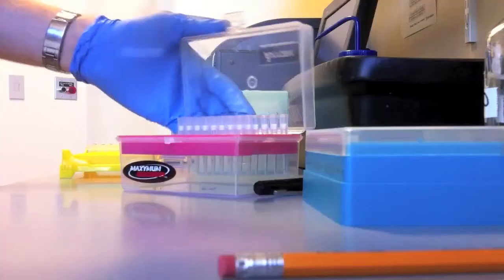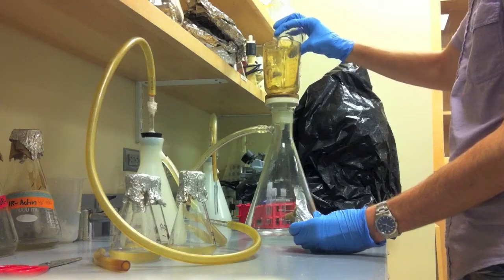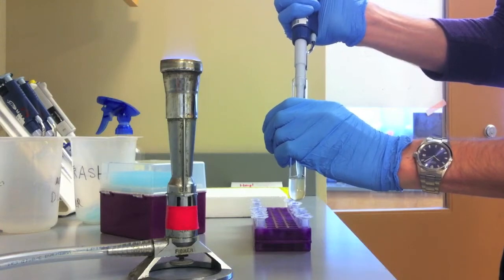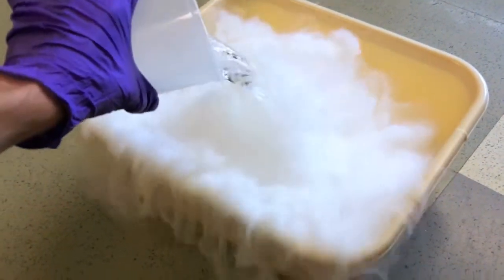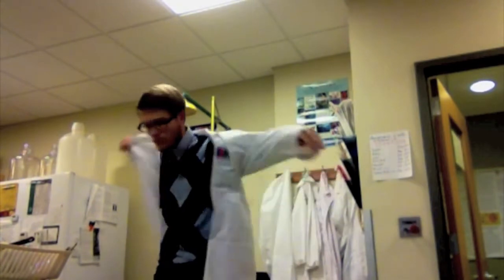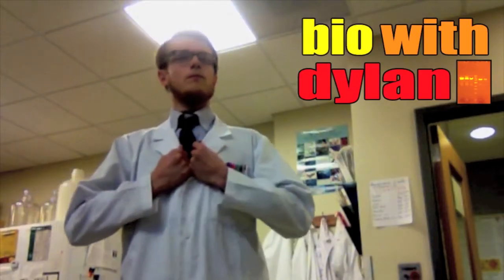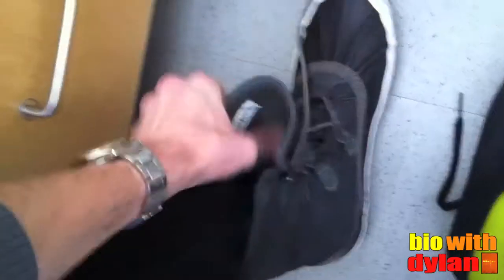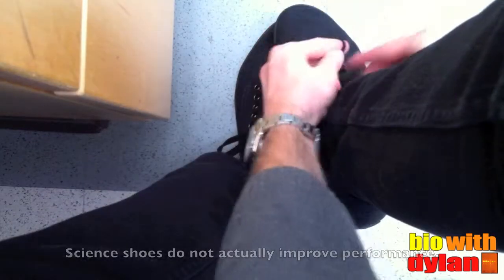Time to do science! Once I get to lab, the snow boots come off and the science shoes go on. And most importantly, I gotta wear a lab coat. Well, actually, no I don't.